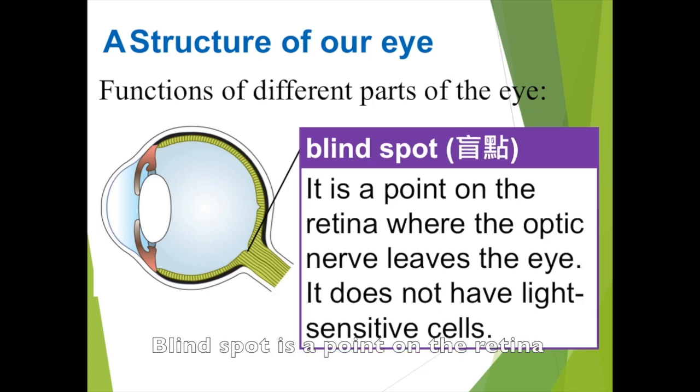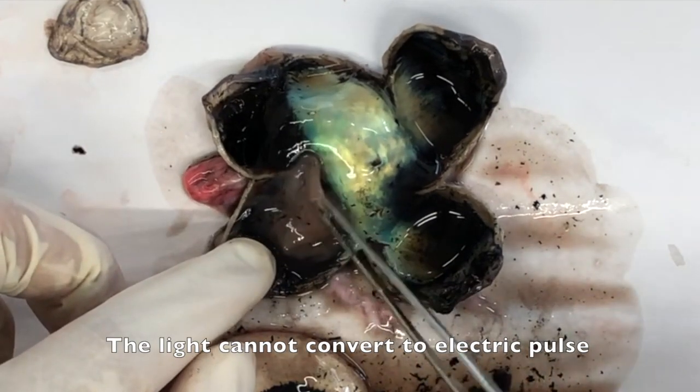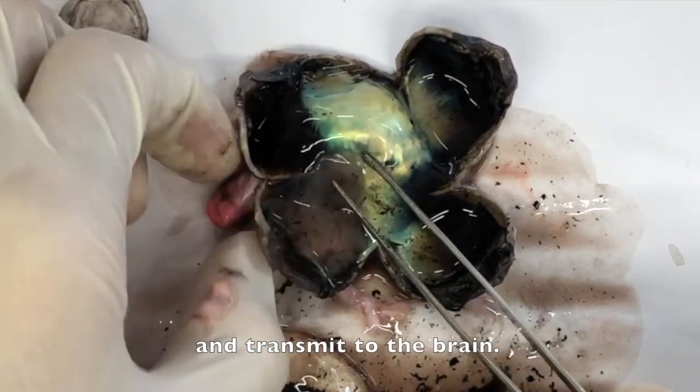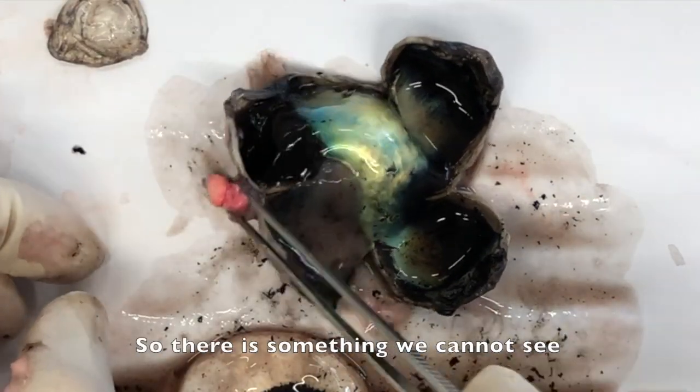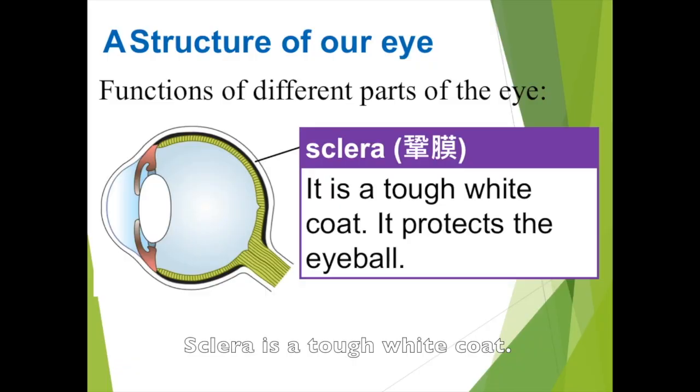And here is the blind spot, a point on the retina where the optic nerve leaves the eye. It is there because there are no light-sensitive cells on the blind spot. That means even if light falls on the blind spot, the light cannot be converted into an electric pulse to the brain. So there is something we cannot see if we are using a single eye. Finally, it is the sclera, a tough white coat that protects the eyeball.